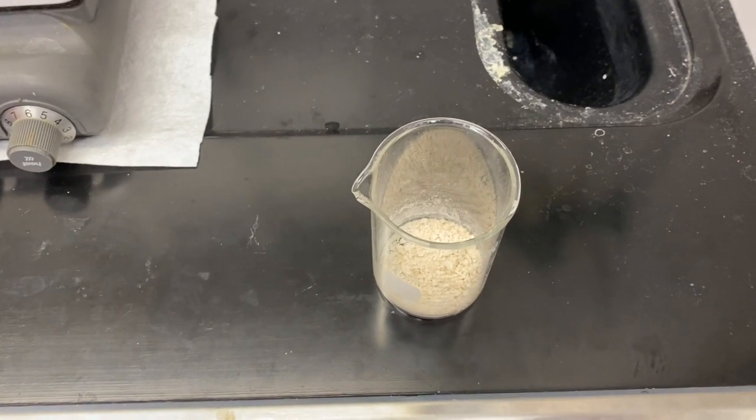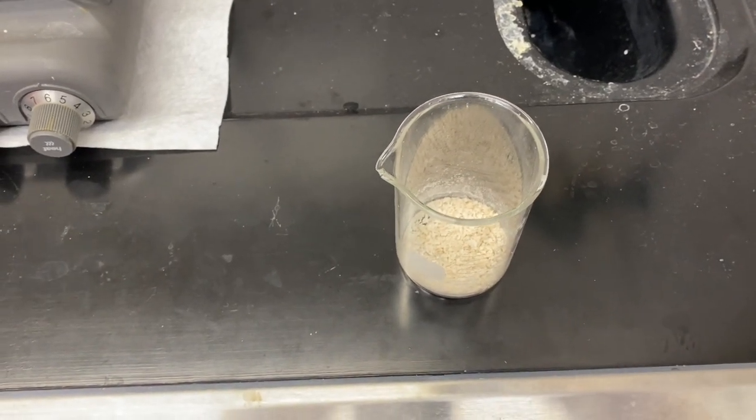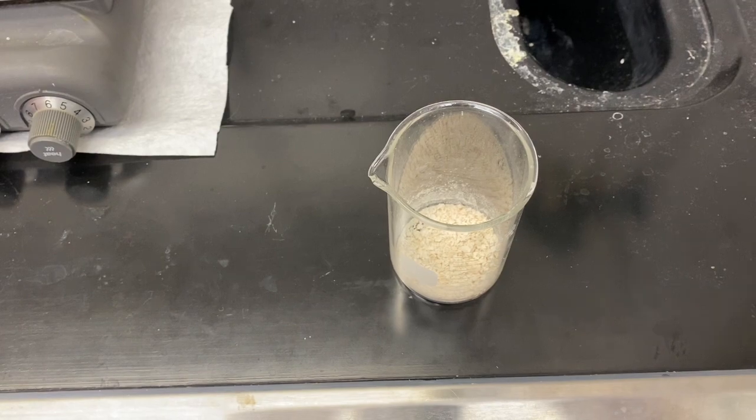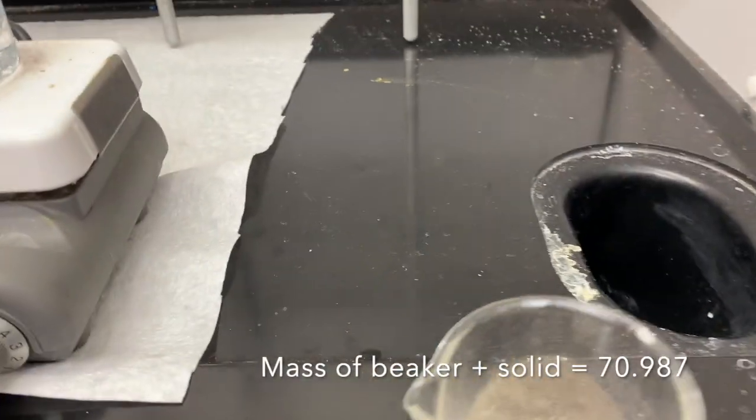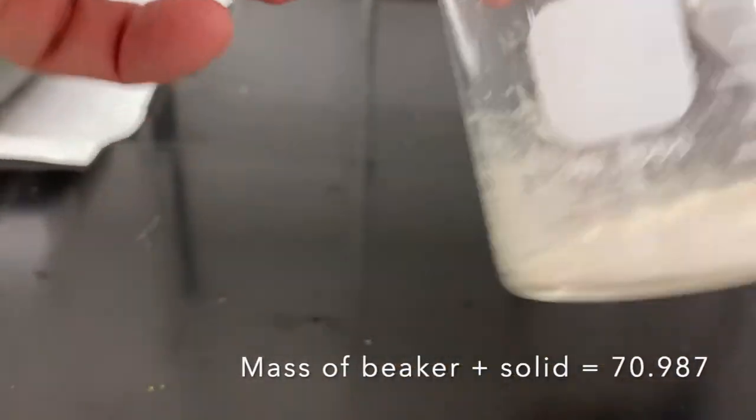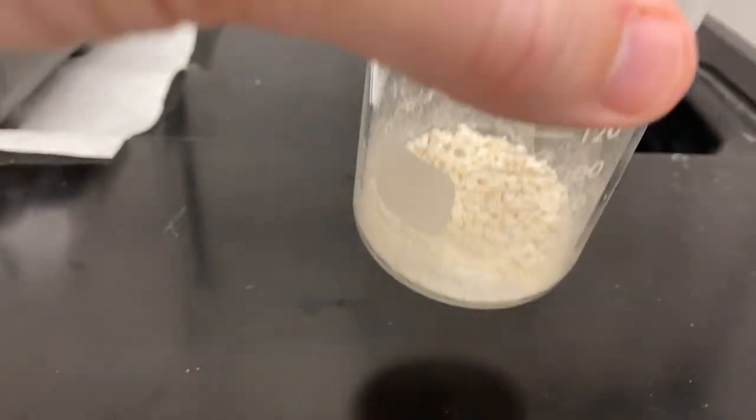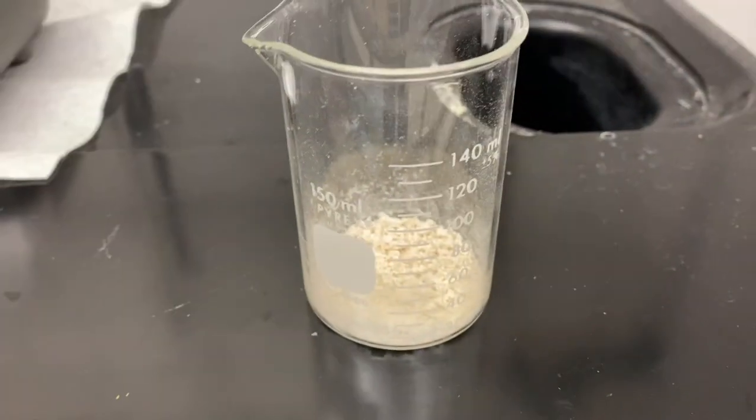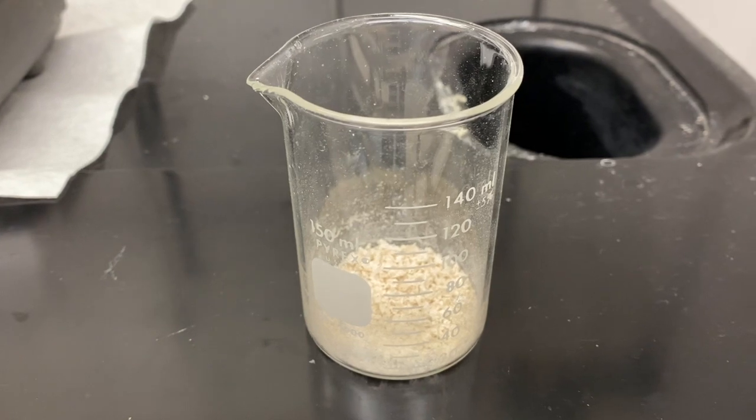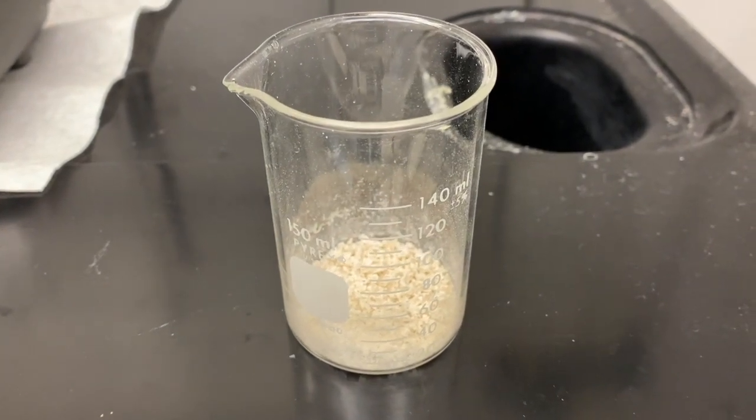You may remember this beaker from when it was full of liquid. The liquid has evaporated, and we're just left with this off-white powder that we're going to recrystallize. You'll see that or a video related to it shortly. Thank you.